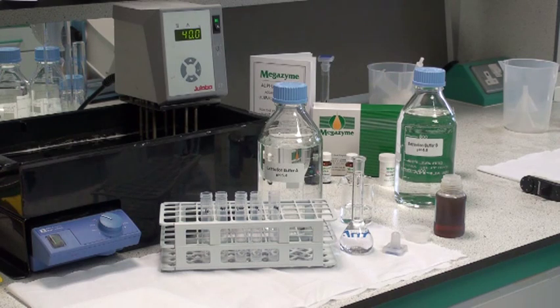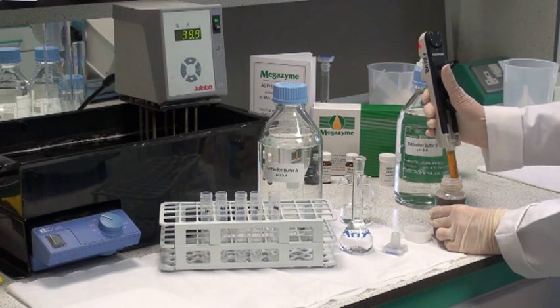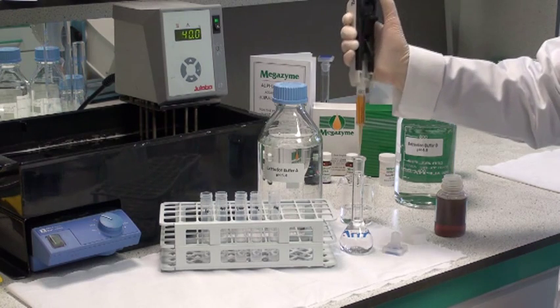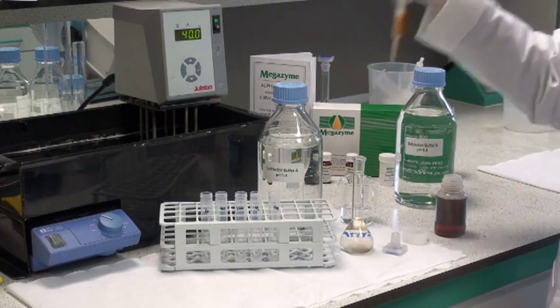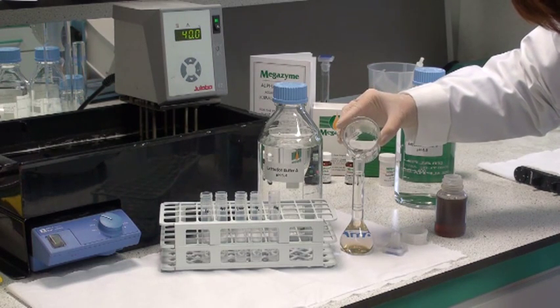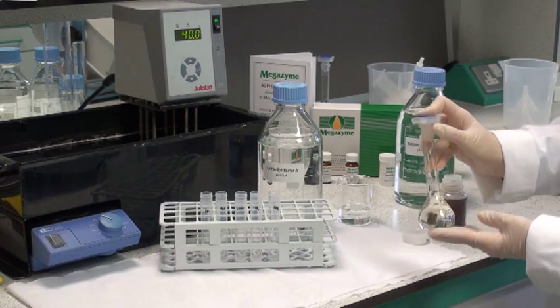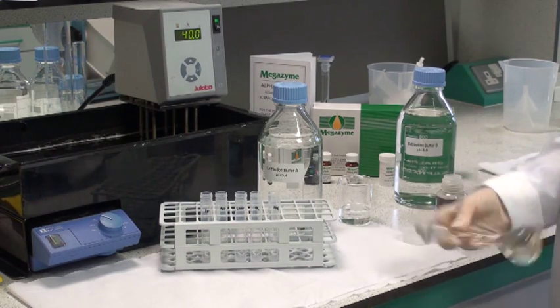For liquid microbial preparations, transfer 1ml of the enzyme preparation to a 50ml volumetric flask containing the extraction buffer, which may be either pH 5.4 or 6.5 depending on the alpha-amylase being assayed. This transferring should be done with a positive displacement dispenser because the preparation is usually very viscous. Adjust the volume in the flask to 50ml using the extraction buffer, then cap the flask and mix very thoroughly. It's very important to mix well because the enzyme preparation is usually in glycerol or something similar and very viscous.